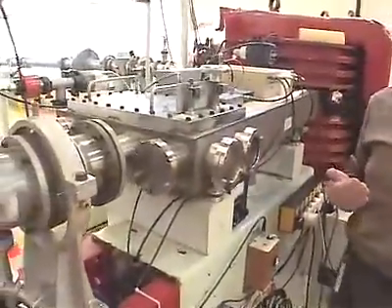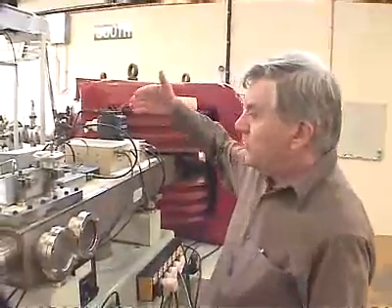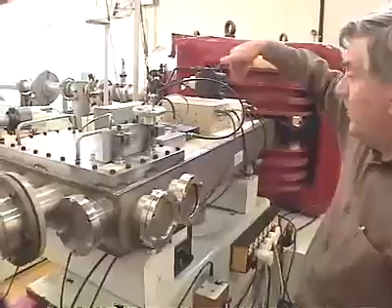This magnet acts very much like an old cream separator that used to be on dairy farms. You put the milk and the cream together, you spin them very fast, and the heavy cream goes to the outside, the light milk goes to the inside. And that way we can get the cream out through one spout and the milk out through the other. Well, we're going to do exactly the same thing with our carbon atoms. The radiocarbon atoms that we want to measure are heavier than the ordinary carbon atoms. So the lighter ordinary carbon goes on the inside of the track in this direction, while the heavier radiocarbon comes straight out past this tube down towards the other end where we have our detecting device.